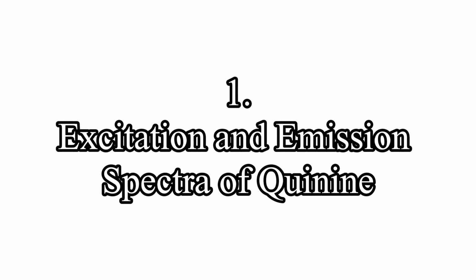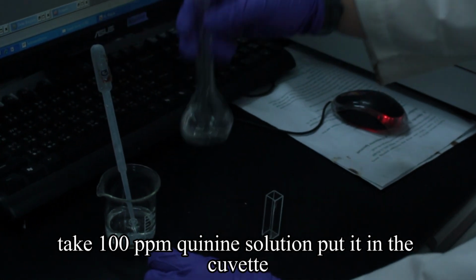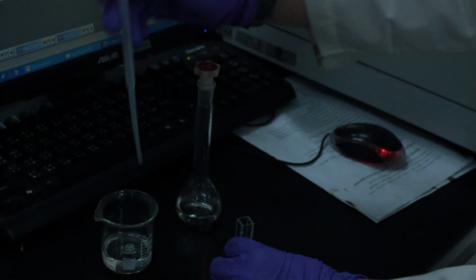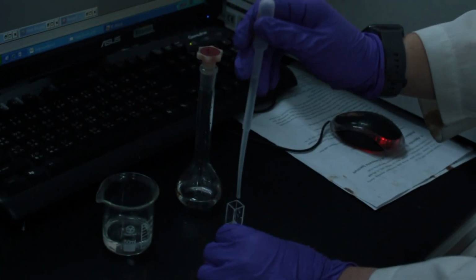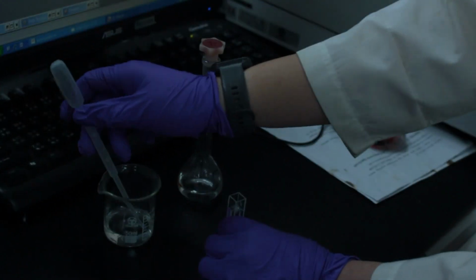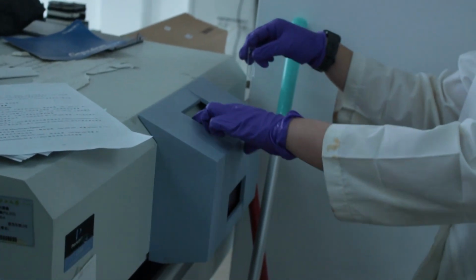Step 1. Excitation and emission spectra of quinine. Take 100 ppm quinine solution, put it in the cuvette, and then put the cuvette into the FL instrument.